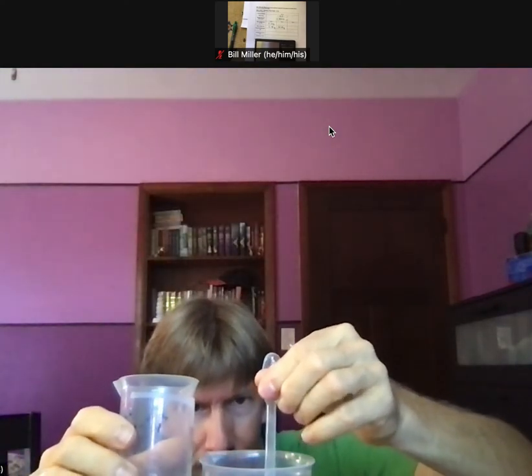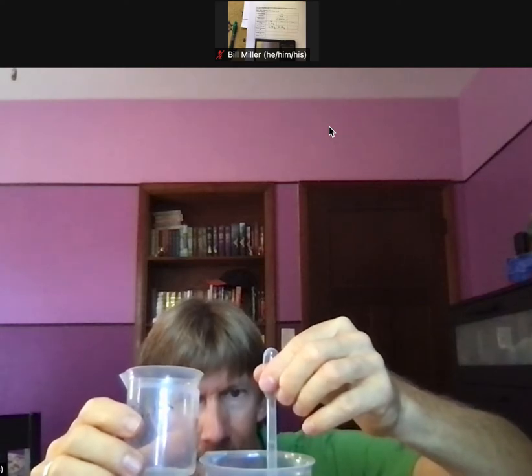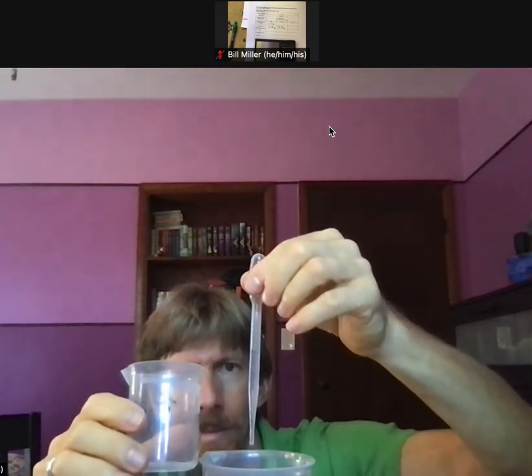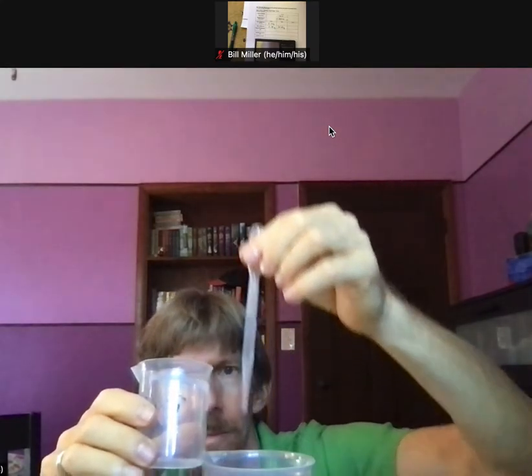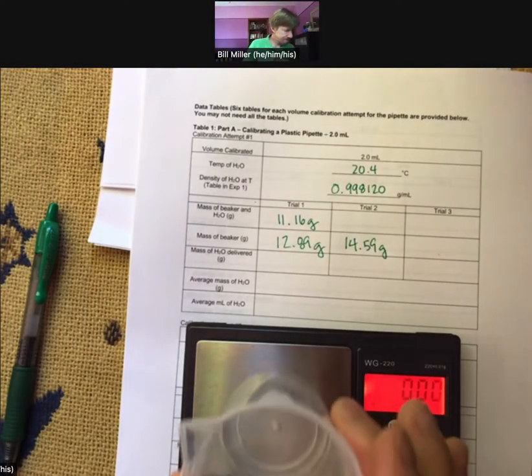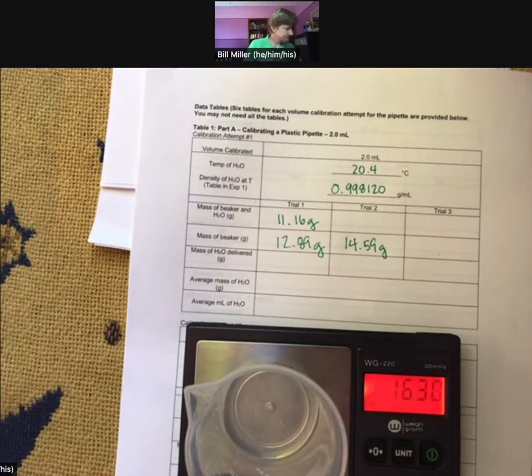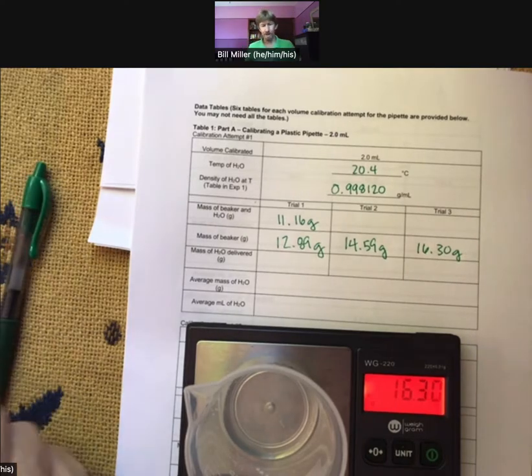Do it again — looking straight across, that's the best way to do it, because you're trying to get it right at that line. 16.30 grams. That's all my data for calibration attempt number one.